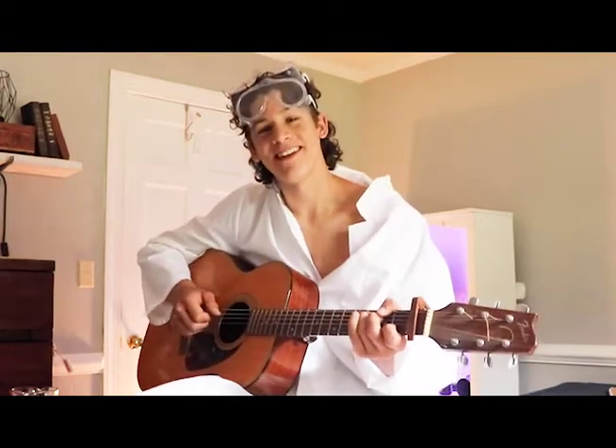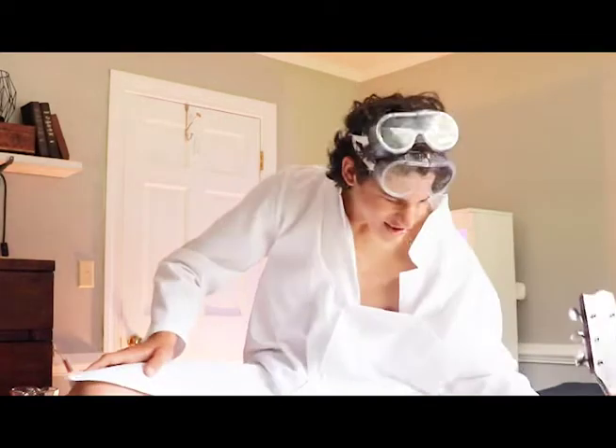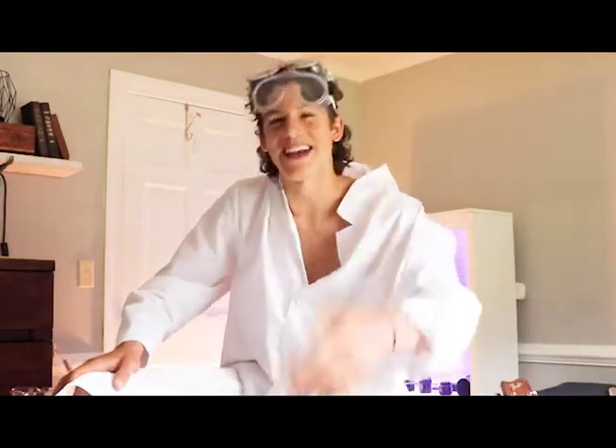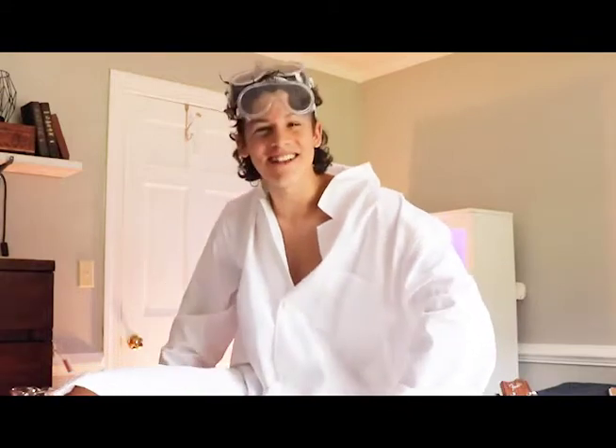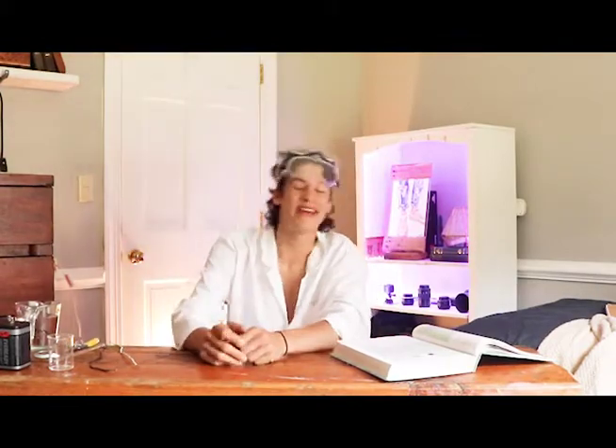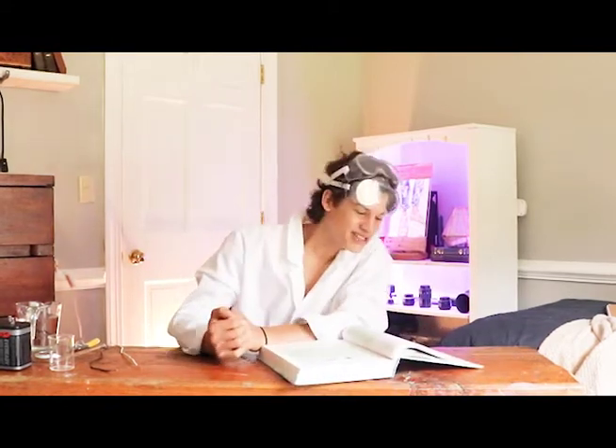Welcome! You seem to have caught me in the middle of writing a song to my good friend, Science. But that's not why you're here today. You're here today to learn about science. So let's do that. Today we're going to be experimenting with Experiment 2.2. It's a pretty interesting one, and it demonstrates how ionic compounds can conduct electricity in water.